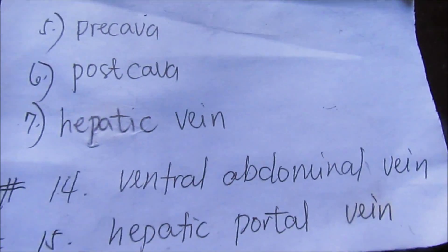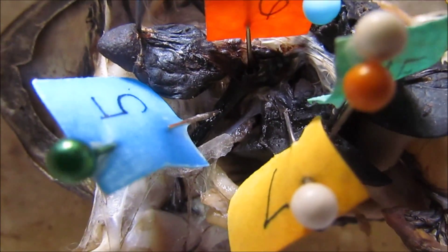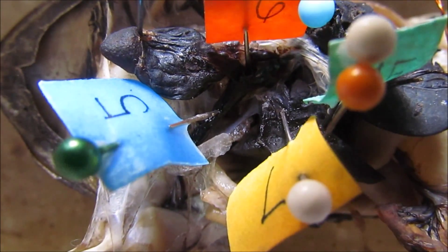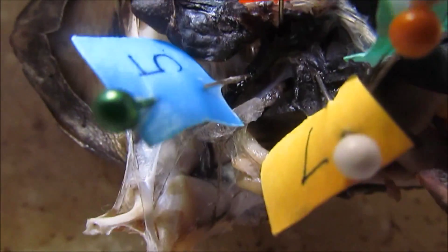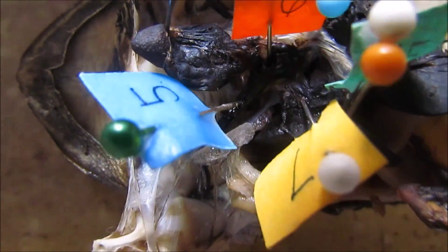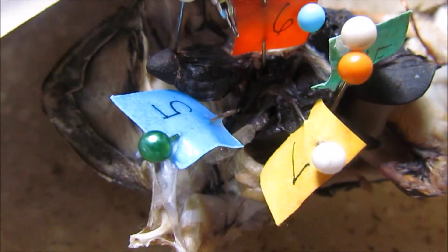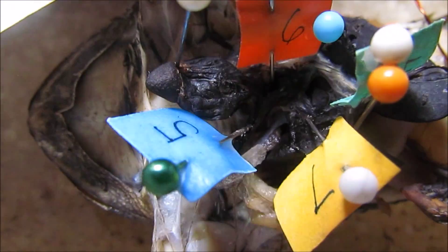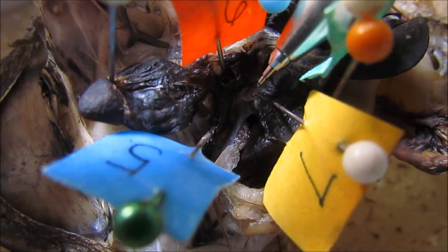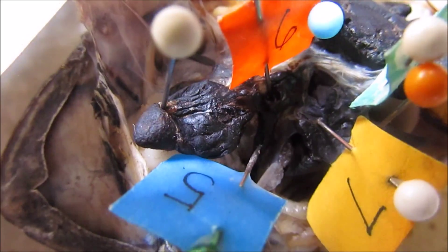So the difference between hepatic vein and hepatic portal vein: the hepatic vein branches out from the postcaval vein, under the sinus venosus of the heart. This is the postcaval. Then once it branches out from the postcaval, that's the hepatic vein — look at number 7. So this is the postcaval directly branching out. For the hepatic portal vein, it does not branch from the postcaval, but it is connected to the ventral abdominal vein.